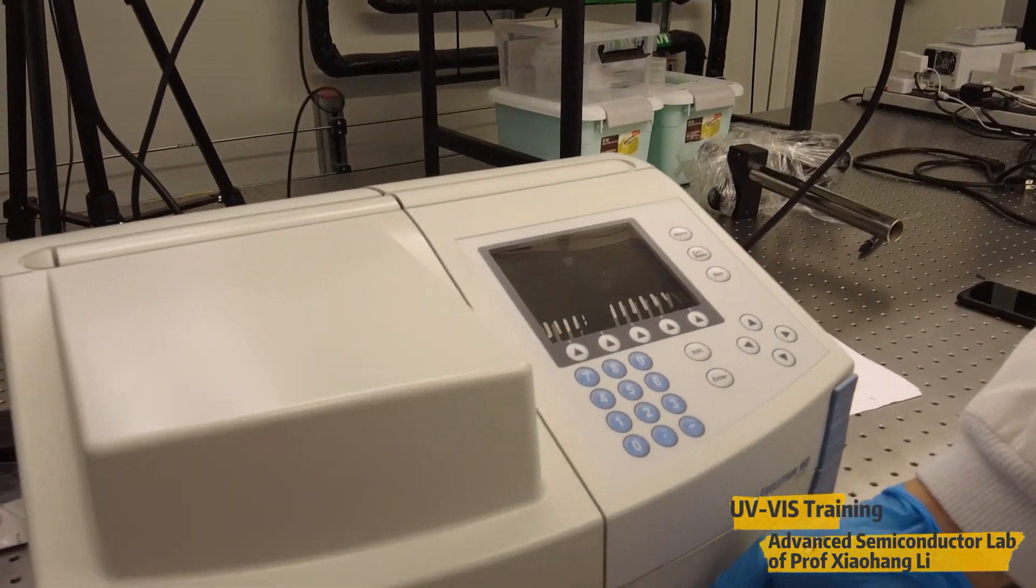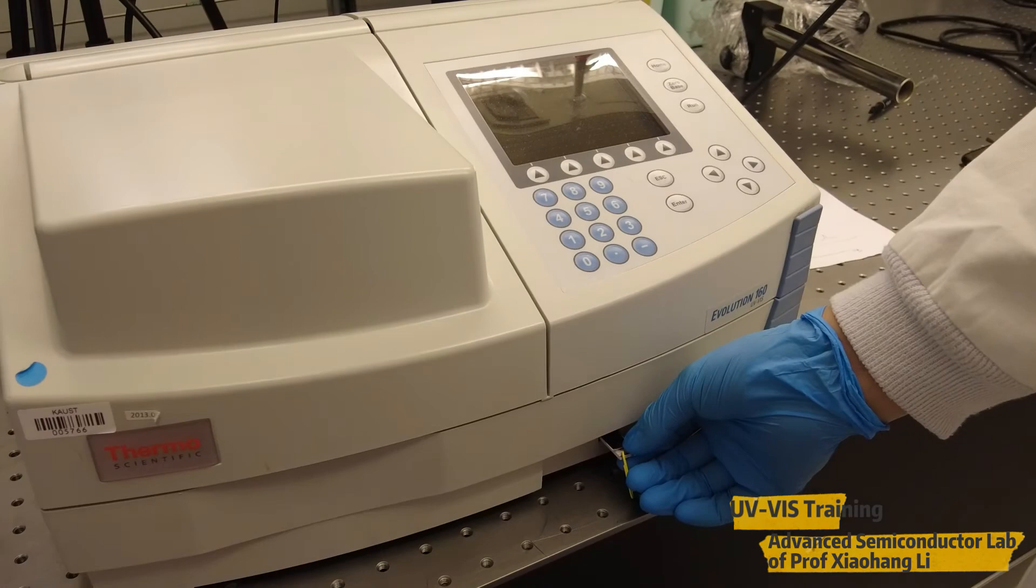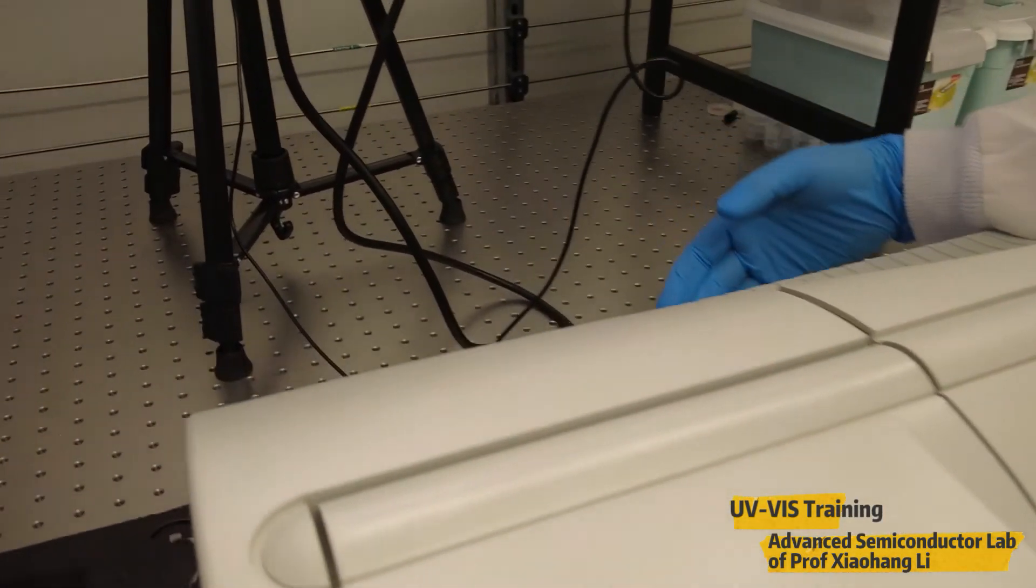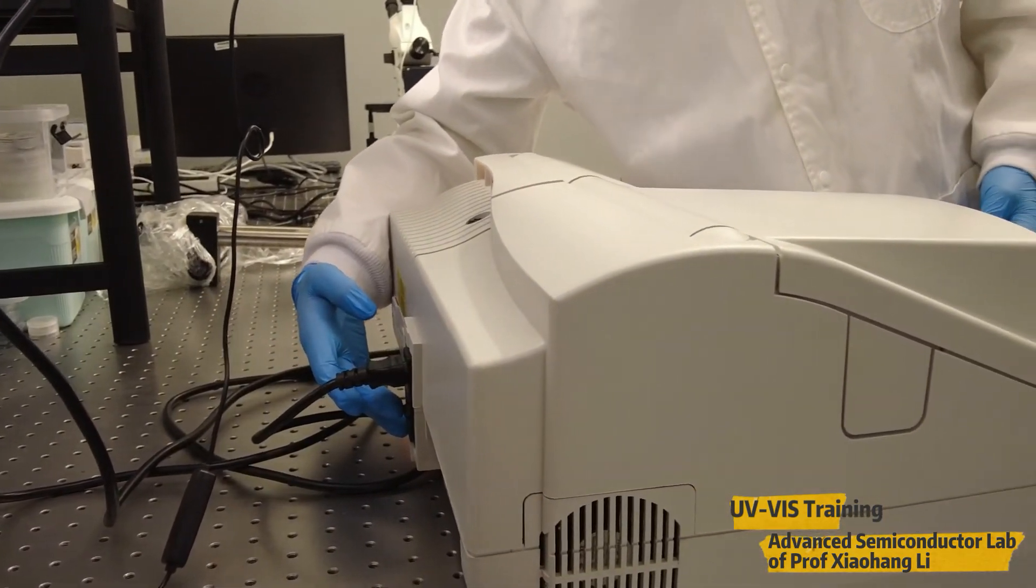After the measurement we can take out the USB memory and also switch off the UV-VIS by pressing here.